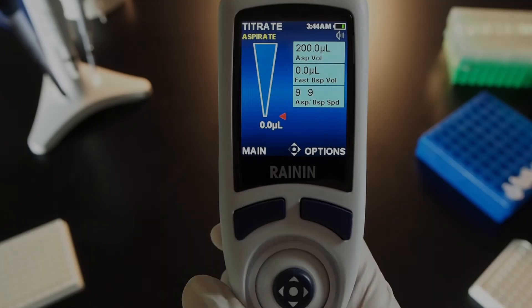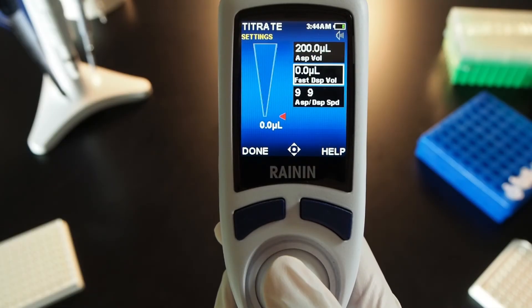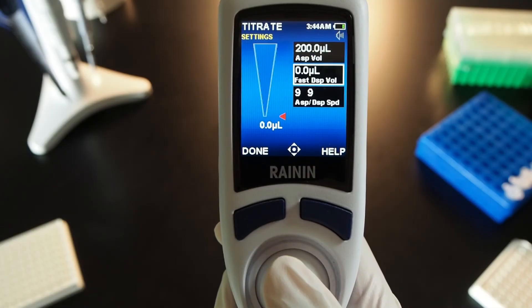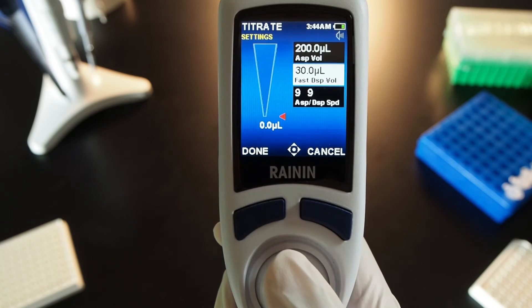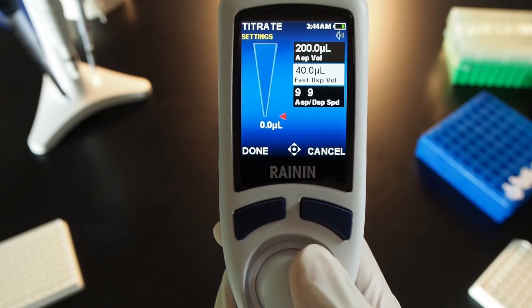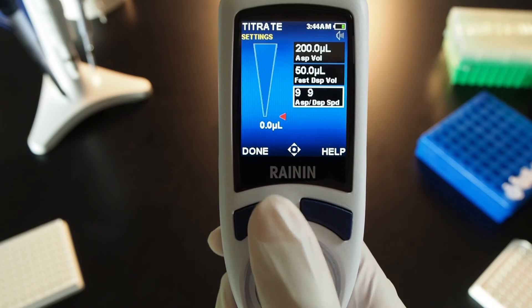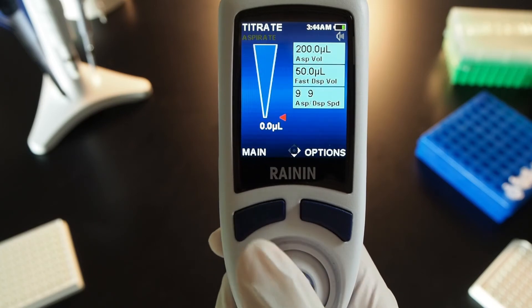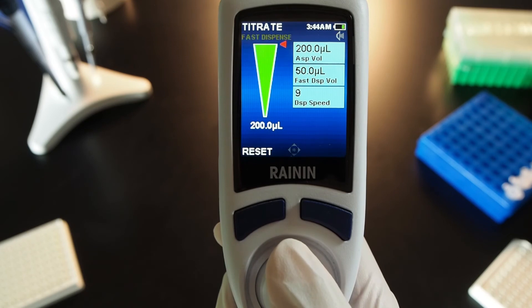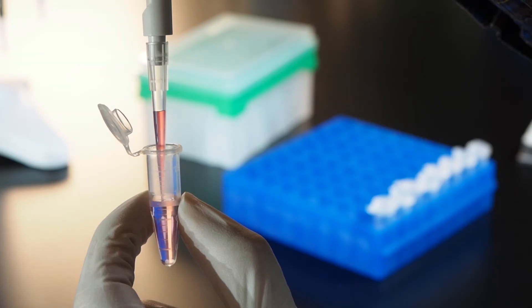Start titration with a set dispense: joystick right, then navigate to the fast dispense volume box and press the joystick to select it. Use the joystick left, right, up, or down to set this initial dispense volume. Press done to exit and press done again to run the titration. Joystick up to aspirate and tap the joystick down to dispense the first volume.